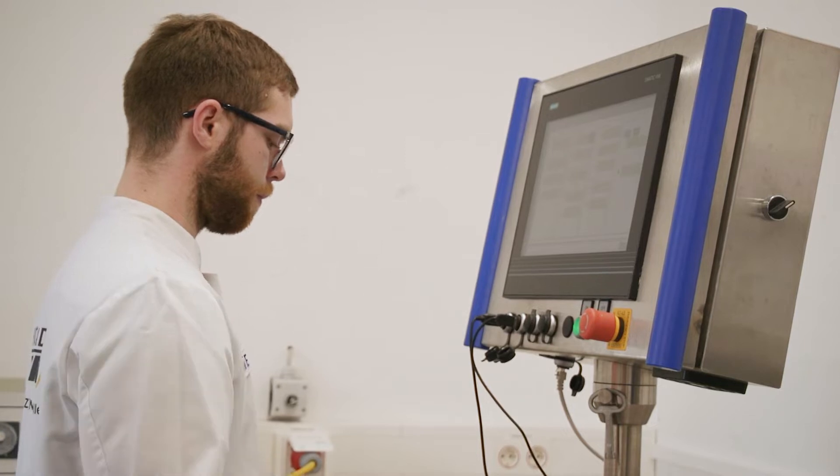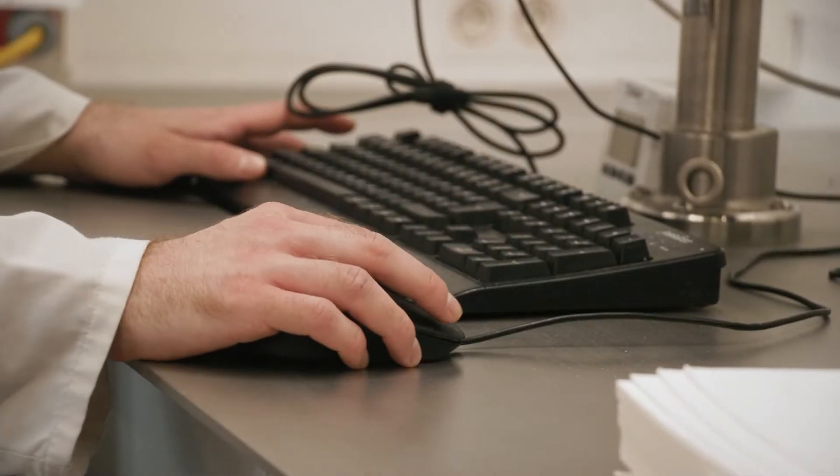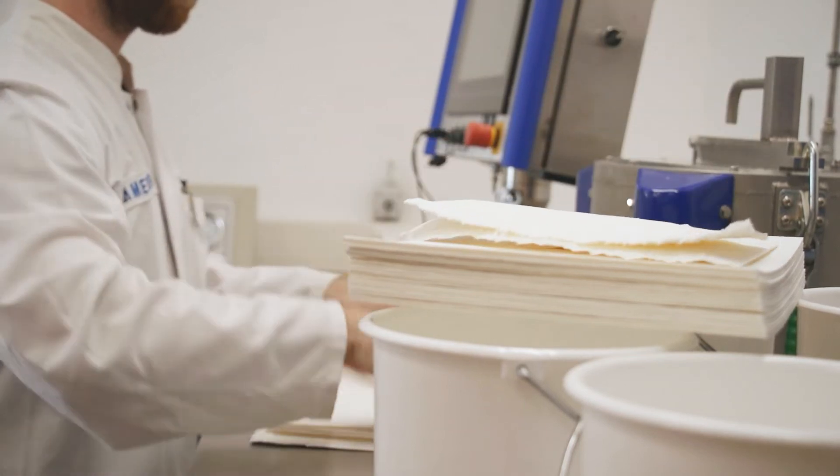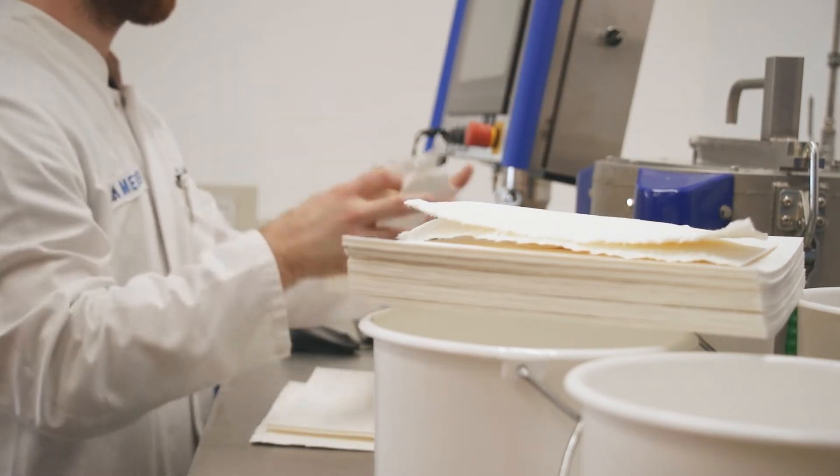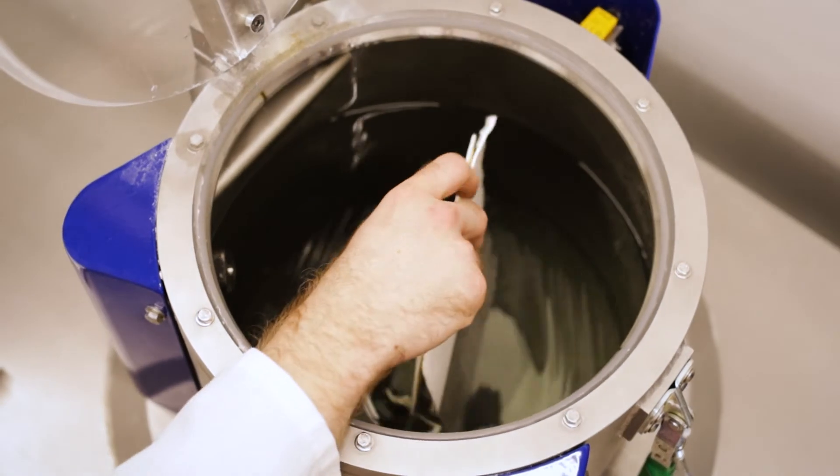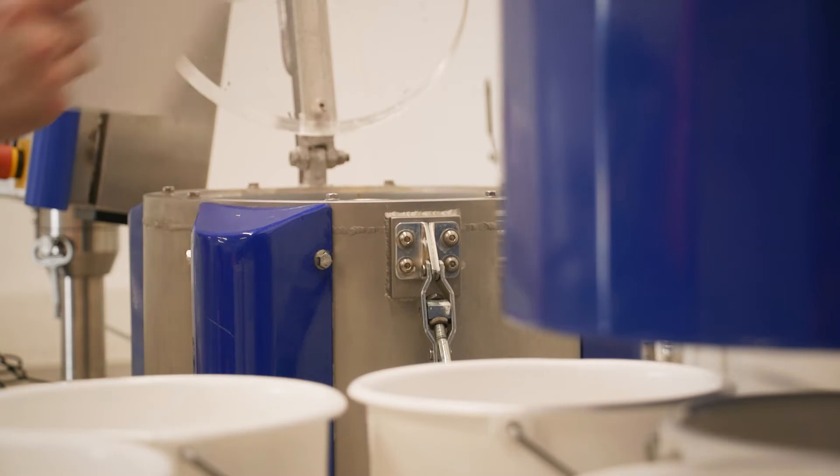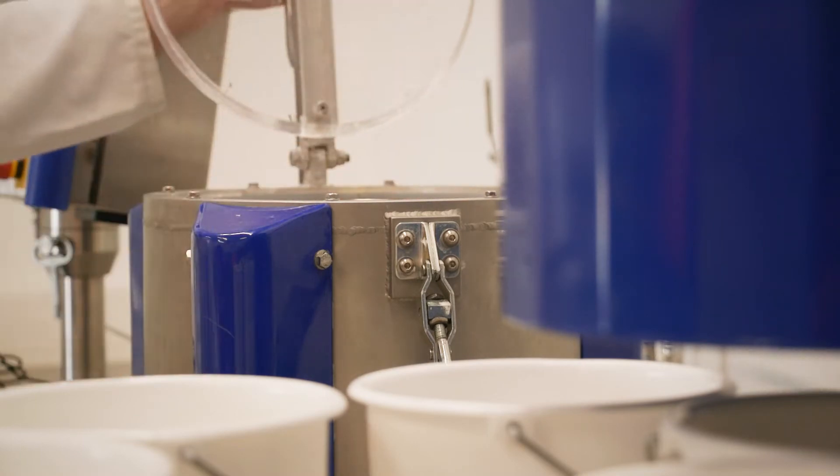With the help of the laboratory refiner we simulate the industrial refining process. To prepare for the experiments we enter the target value for the specific edge load, the number of samples required, and the respective values of the net specific refining energy at which the samples are to be refined automatically.